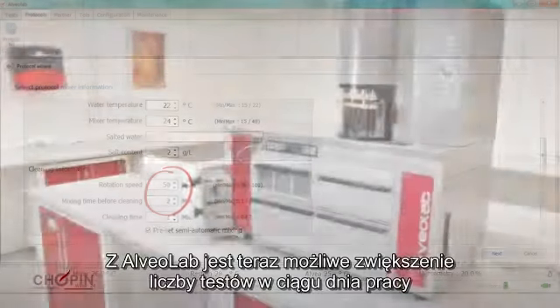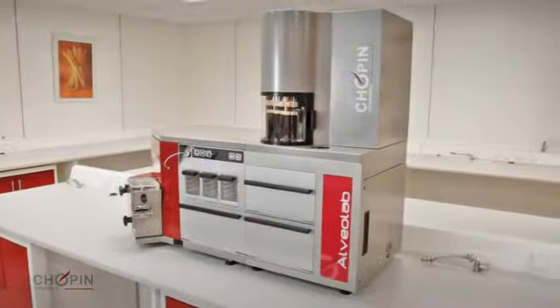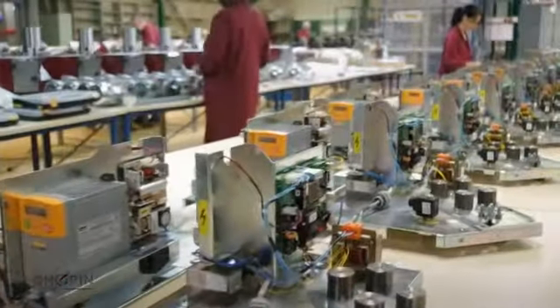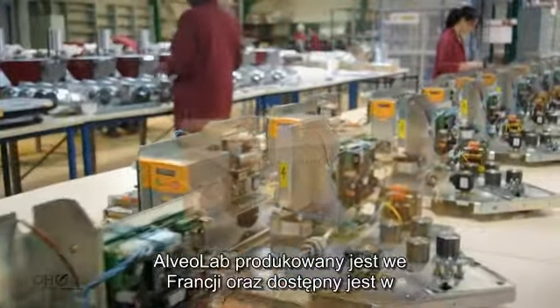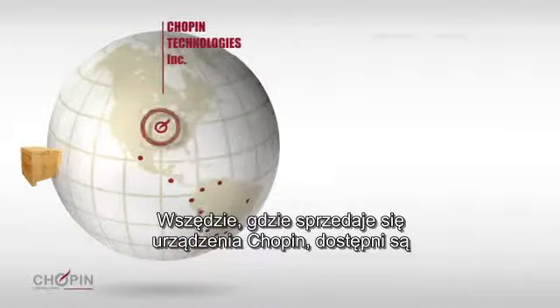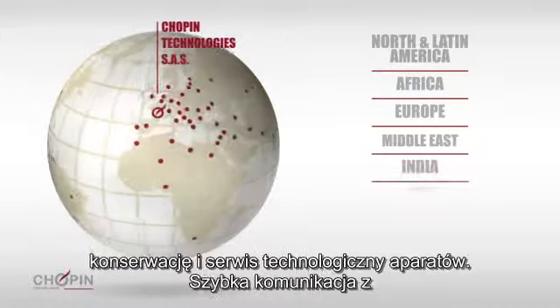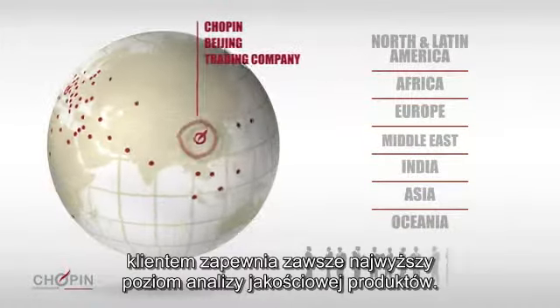Using the Alveolab, it's now possible to increase the number of tests carried out daily, thus optimizing the return on investment. Made in France, the alveograph has a customer base in over 90 countries. All across the world, technicians are available to train users, carry out maintenance and support equipment, and provide a rapid response to ensure quality analysis.